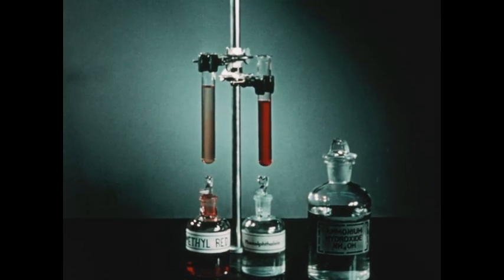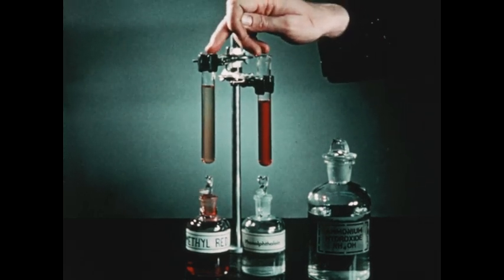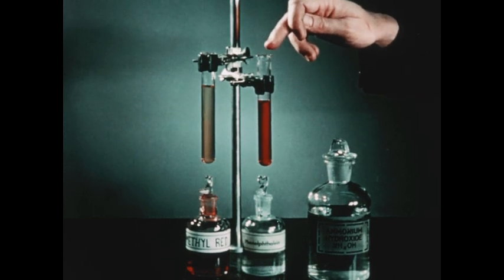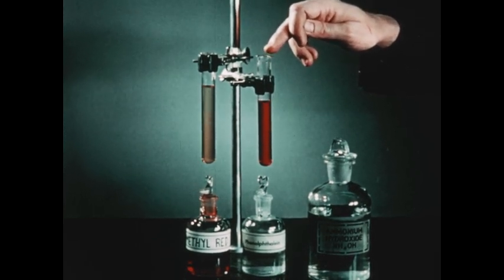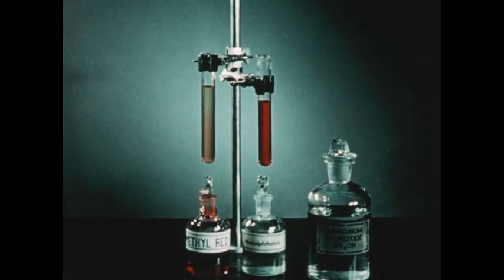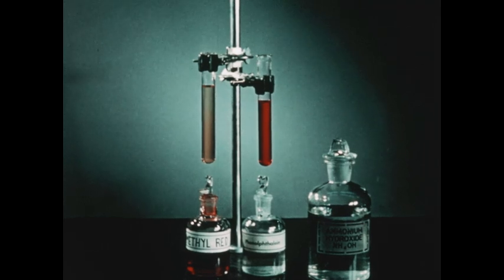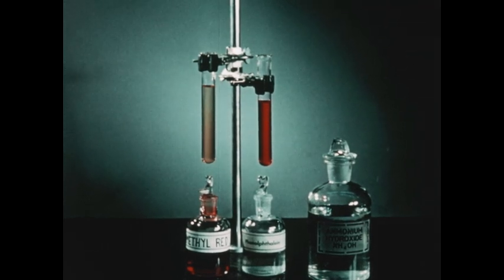You should notice that the methyl red indicator changed from red to yellow, and the phenolphthalein indicator changed from colorless to its characteristic pinkish-red color in basic solutions. Now either of these indicators can be used to test for the presence of ammonia, and we will use them from time to time in the course of the forthcoming experiments.